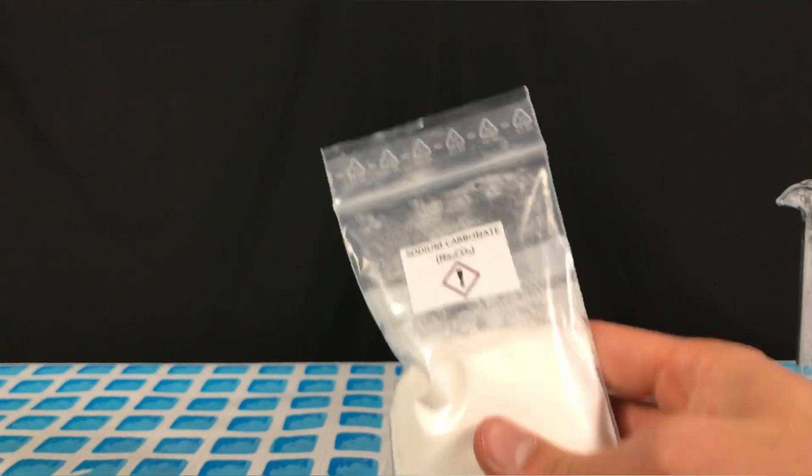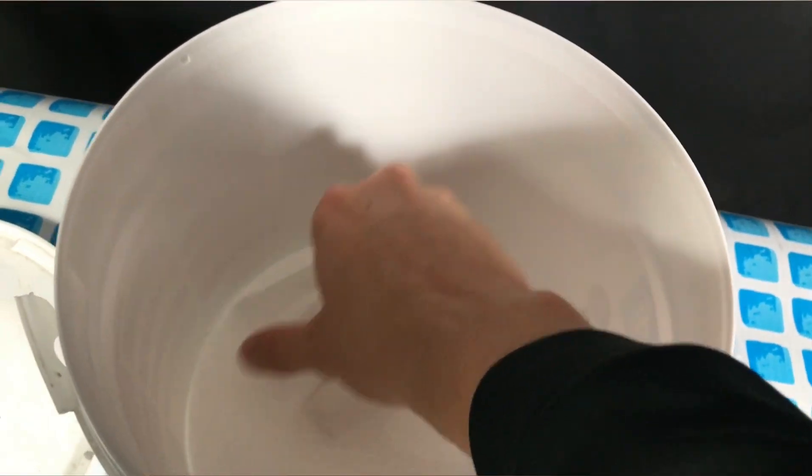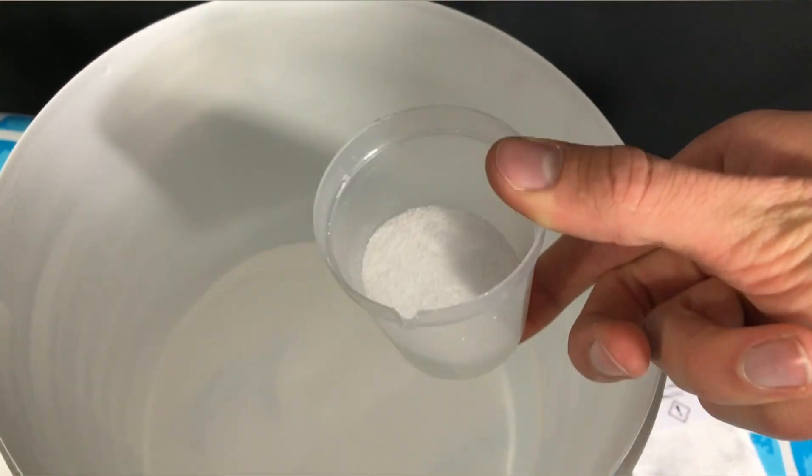We simply wanted to try out this little experiment. Sodium carbonate can also be bought quite cheaply in many stores. It's known as washing soda and can also be found as pH plus for pools.